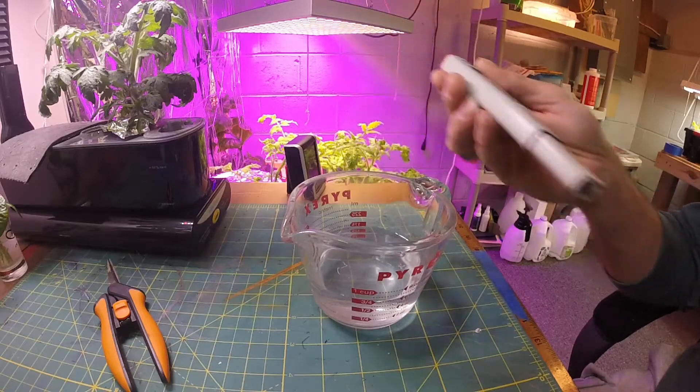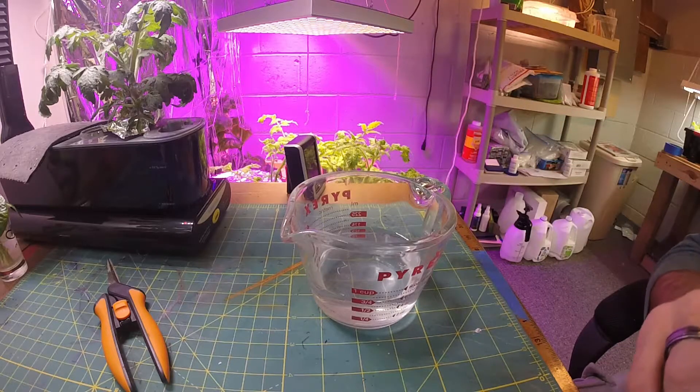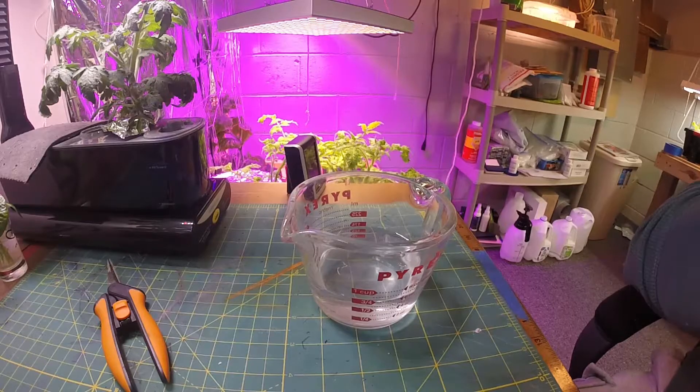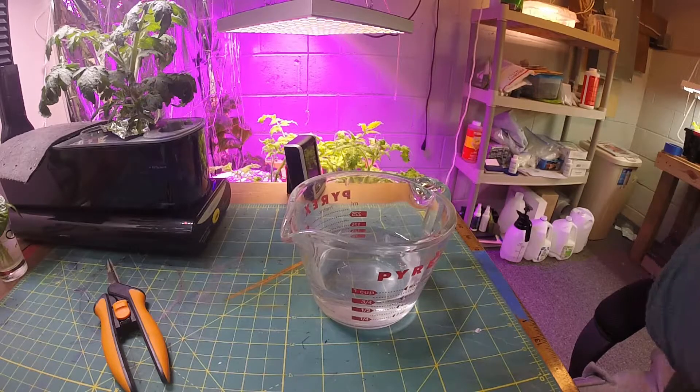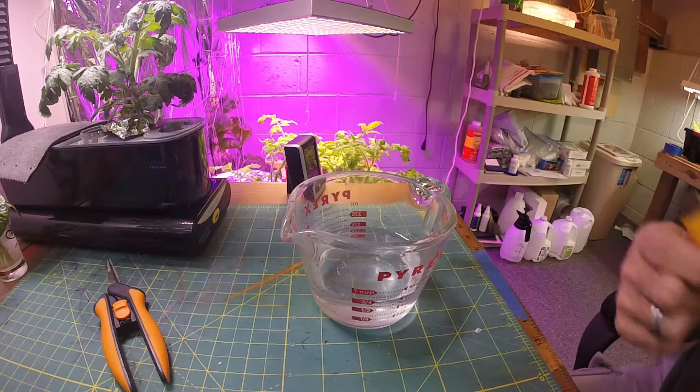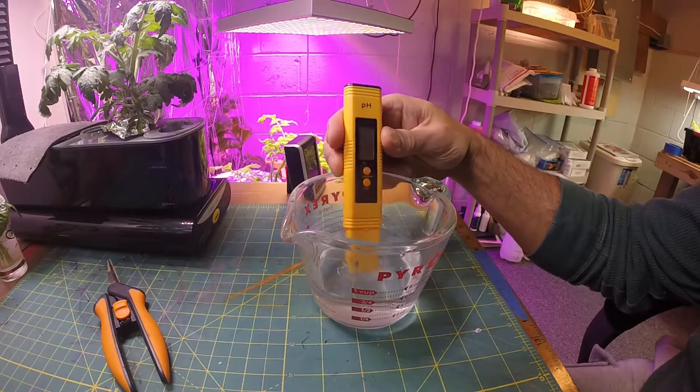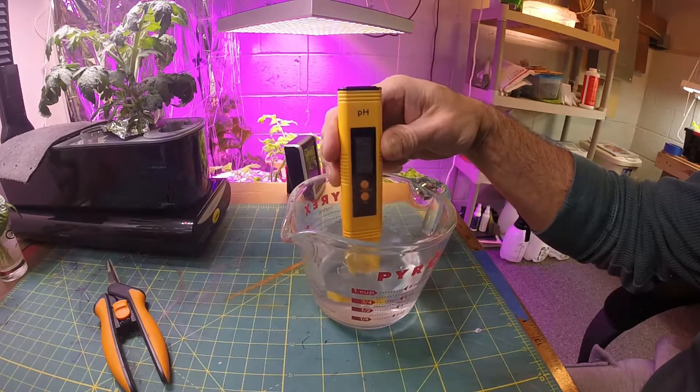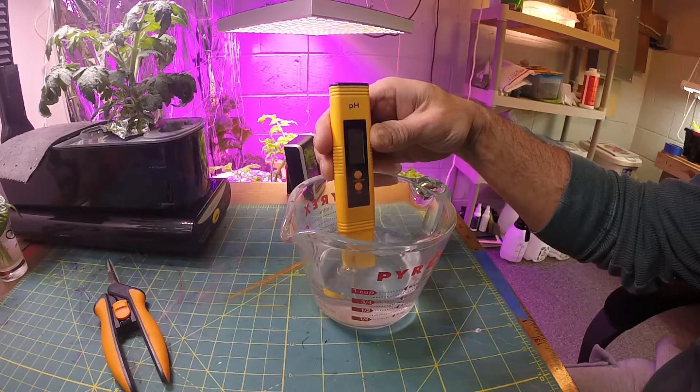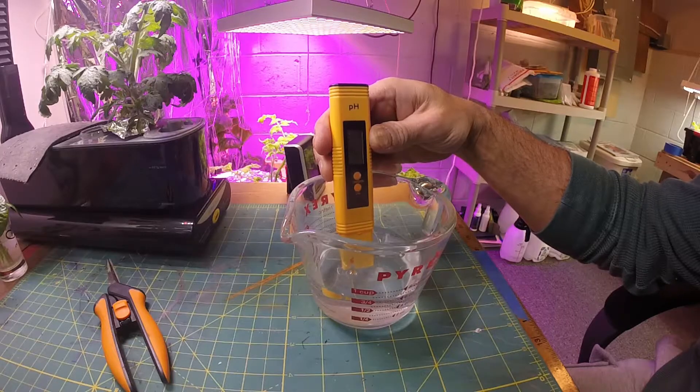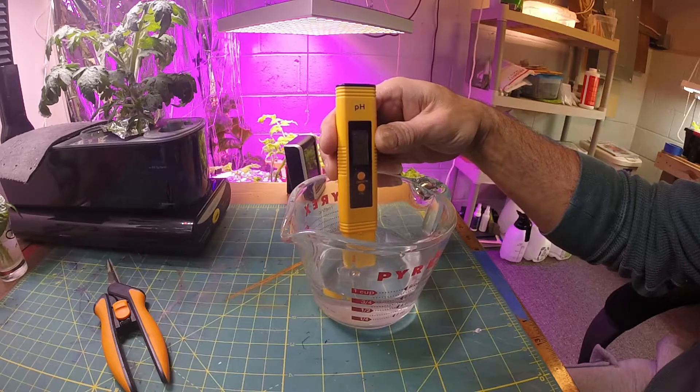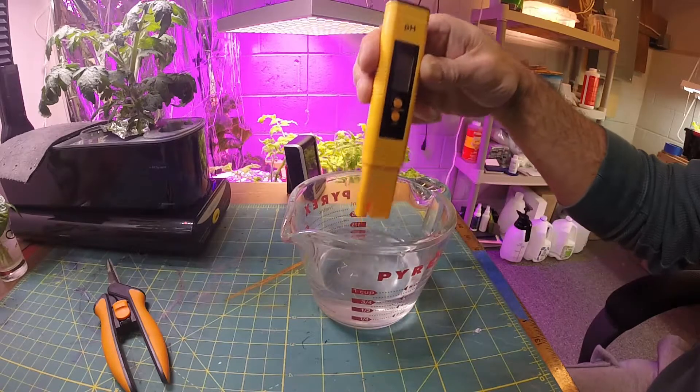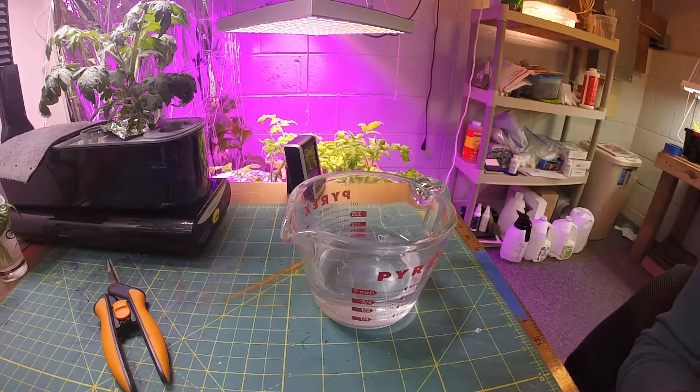What I'm going to do is actually use this, my old meter, when I put this in here to see what it reads. Yeah, see, this one's way off - this is saying two point something. So this one's pretty much broken. This is after I calibrated this one.